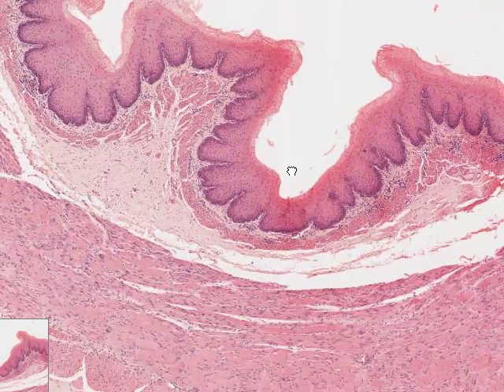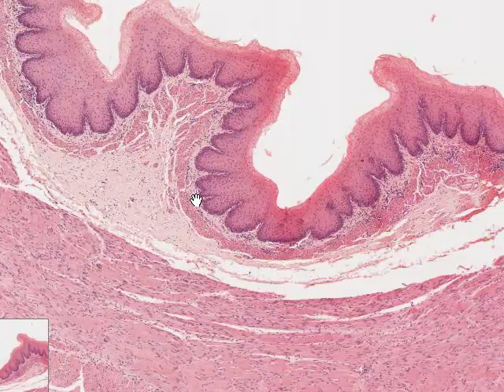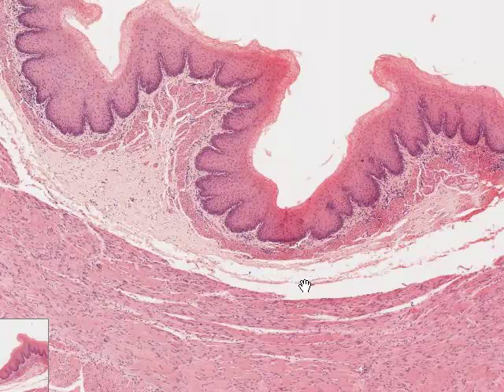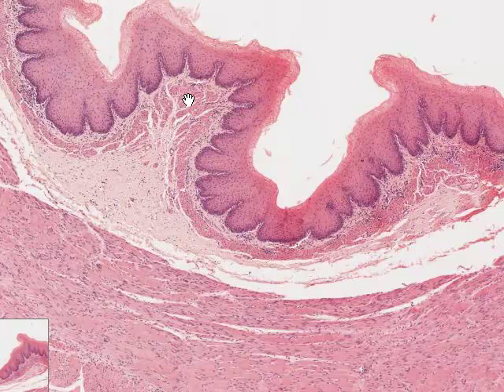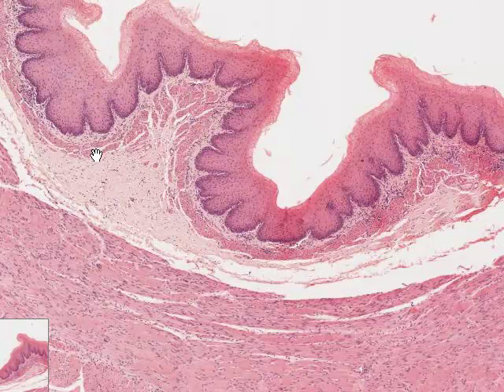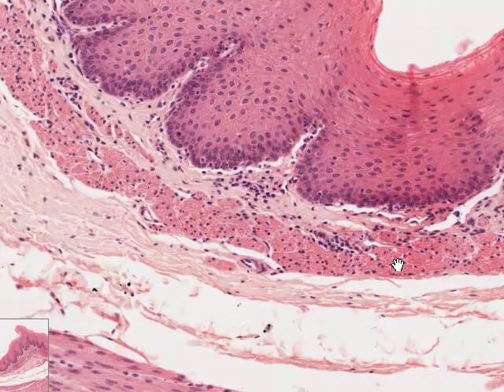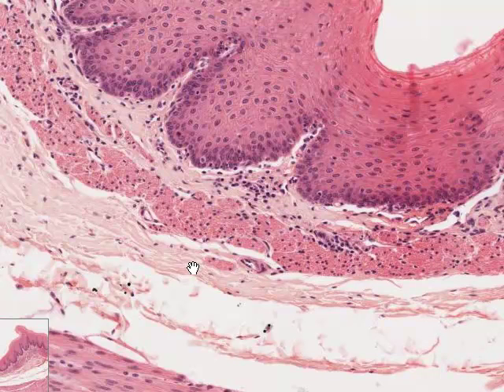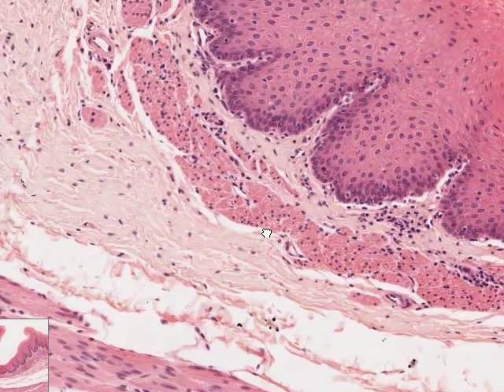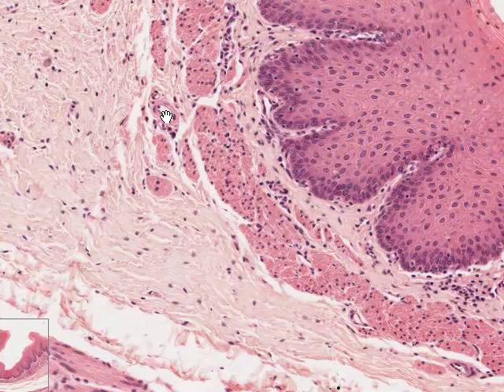Increasing magnification: here's the epithelium, here's the connective tissue just underlying it called the lamina propria, and here is a bundle or strip of smooth muscle that underlies the lamina propria. Depending on orientation, the smooth muscle will be cut either in longitudinal or in cross section. This region here is typical of smooth muscle cut in cross section. There's a small arteriole here, and looking around the connective tissue you can see small blood vessels — here is another arteriole, with endothelial cell nuclei and one layer of smooth muscle.